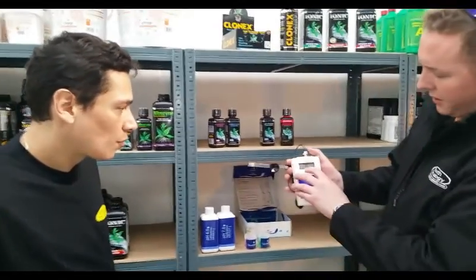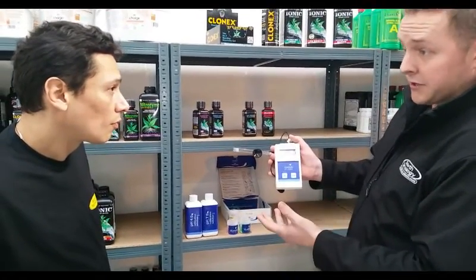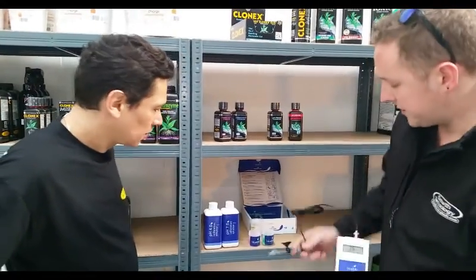At the bottom it says pH 7, and then it's flashing four — so it's telling you to calibrate it to four as well. The next one will be four. We rinse it off in some water just so we don't cross-contaminate it.